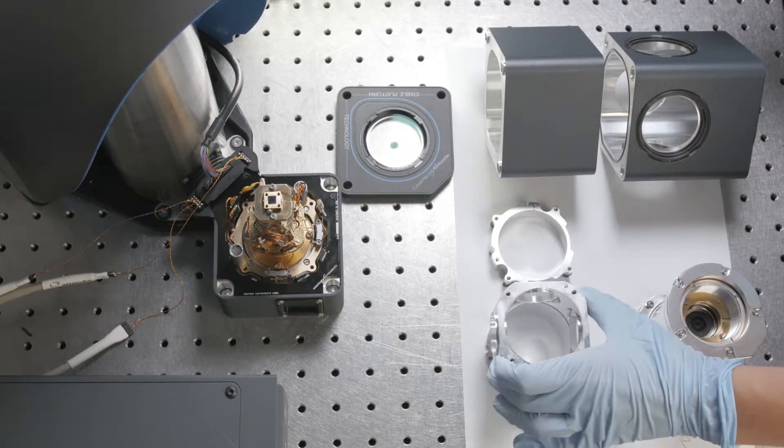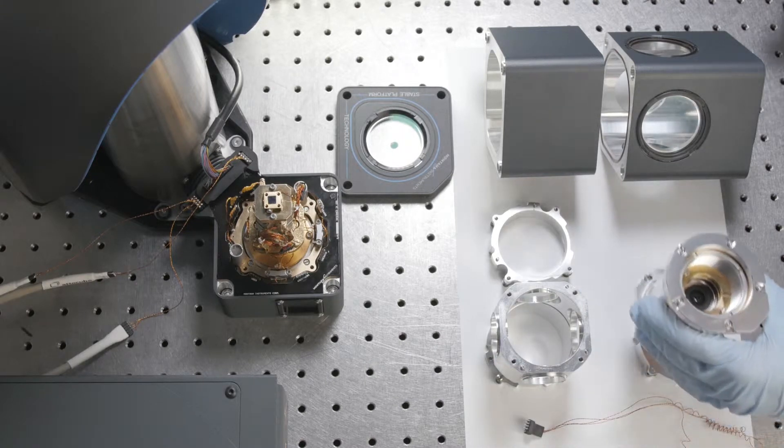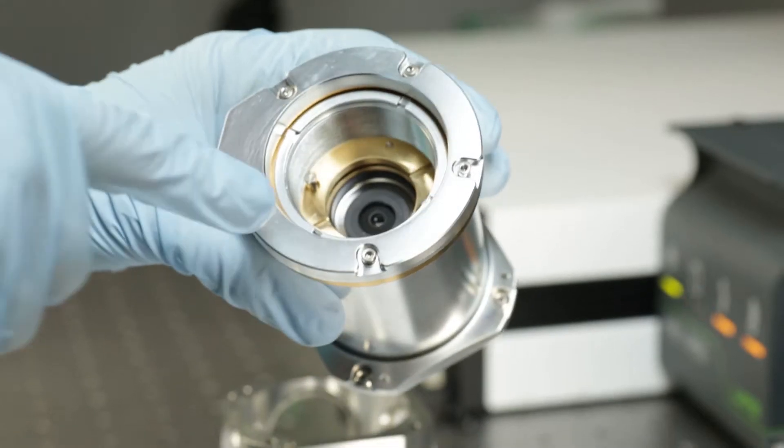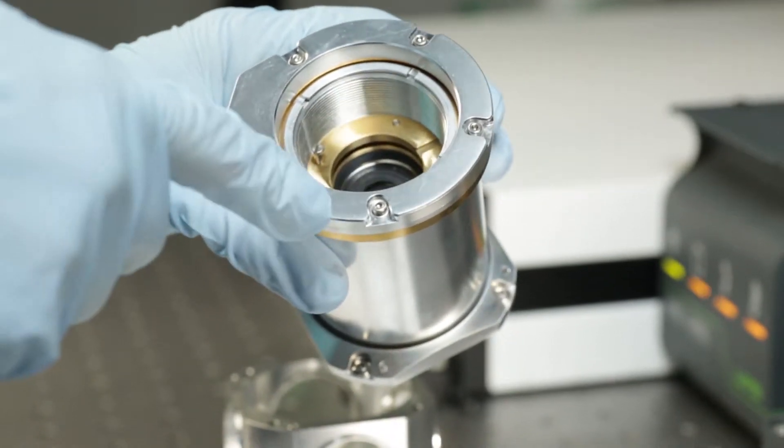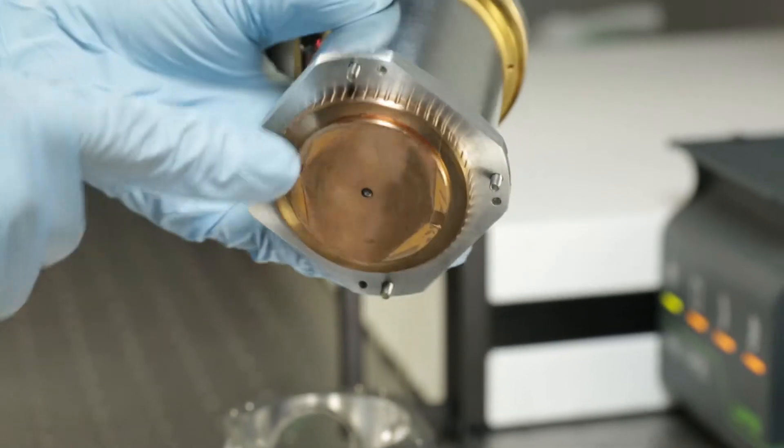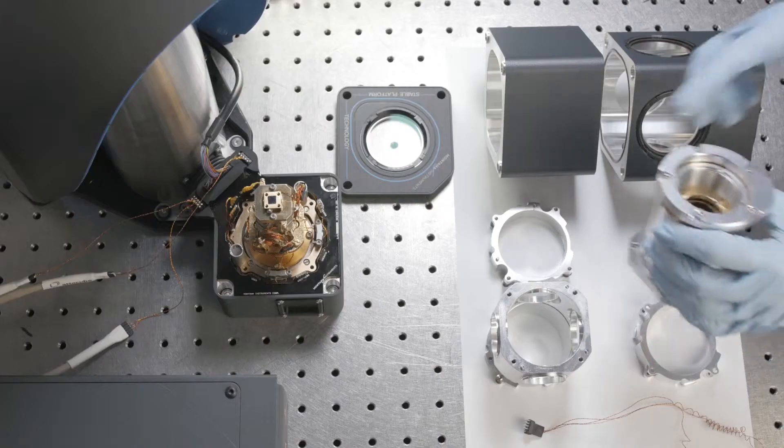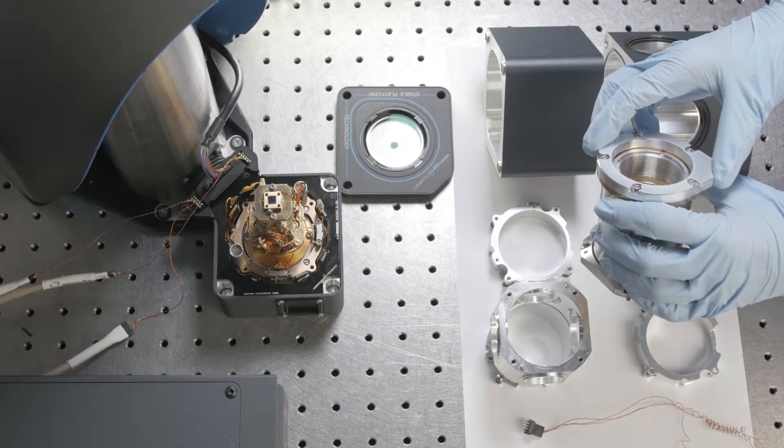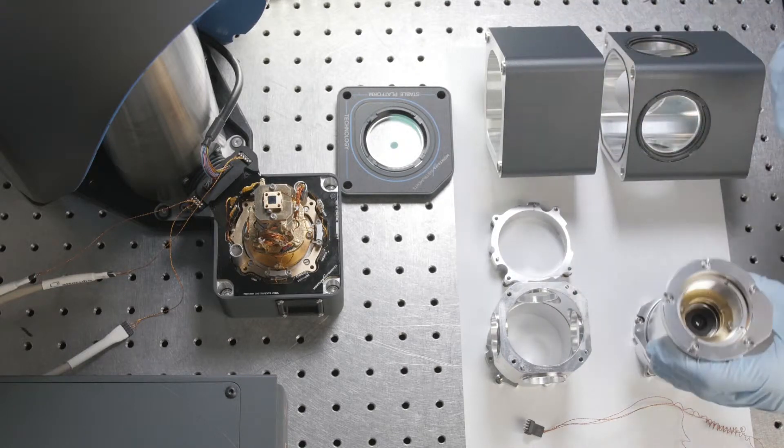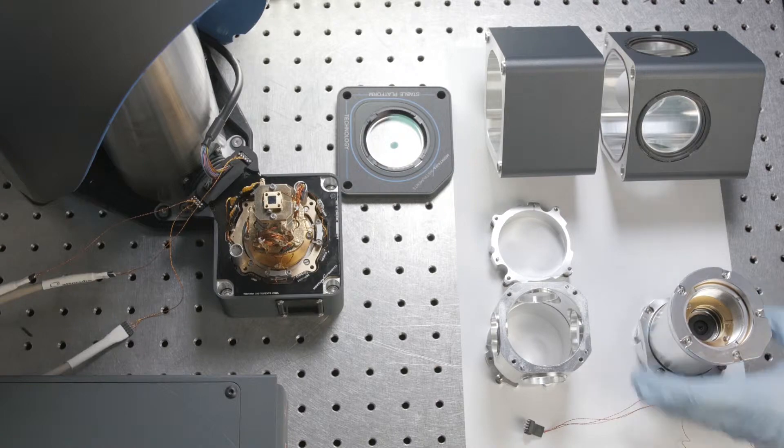Then I'll put on the middle portion of the radiation shield and the cryo-optic holder. The objective comes pre-mounted in the holder. There's a brass locking ring that holds it in place, and on the bottom is a brass aperture. The heater ring that keeps the objective warm is right here.